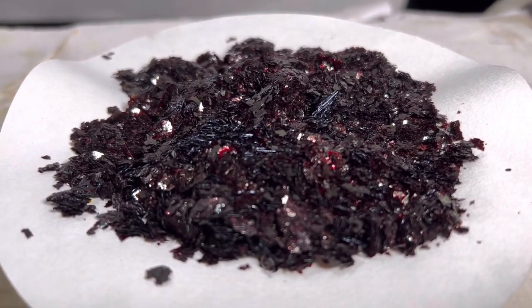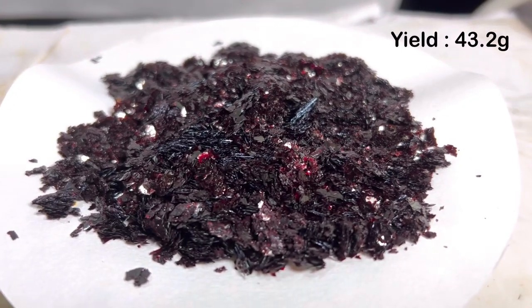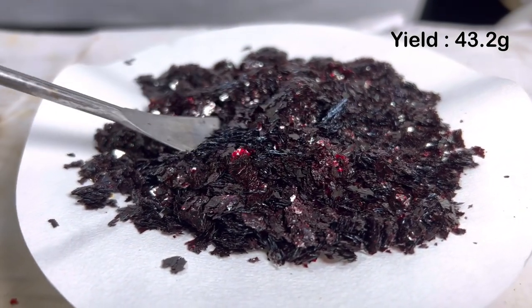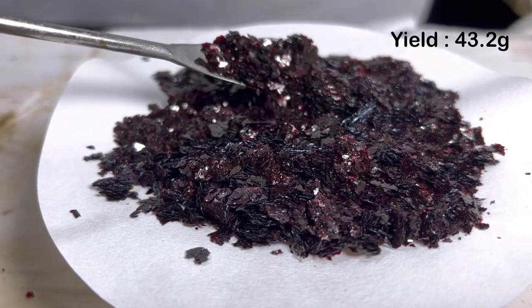This is the final product MOED. I received 43.2 grams of the product. It has this characteristic glistening and the product itself is fluffy and light weighted.